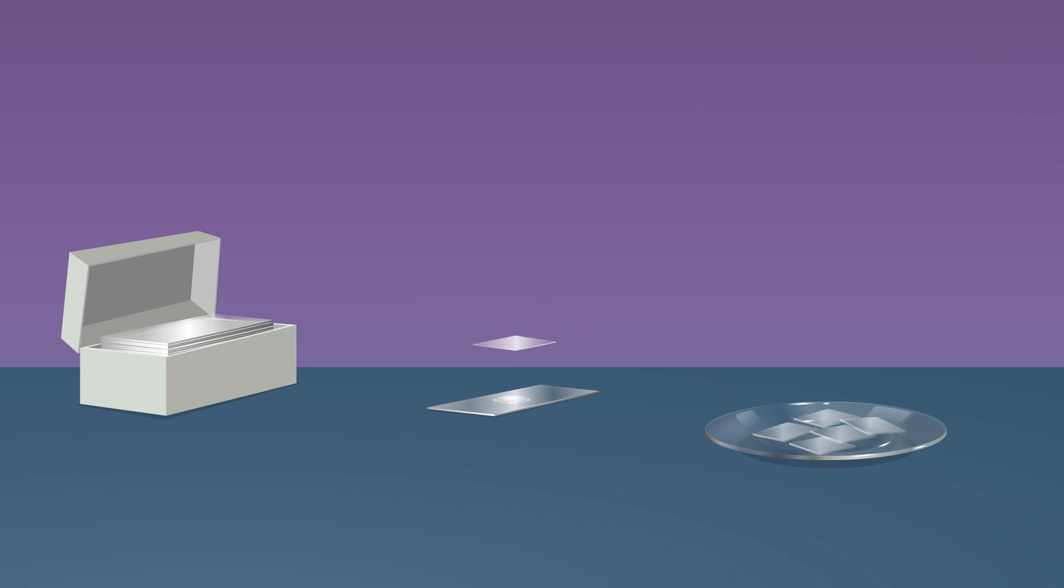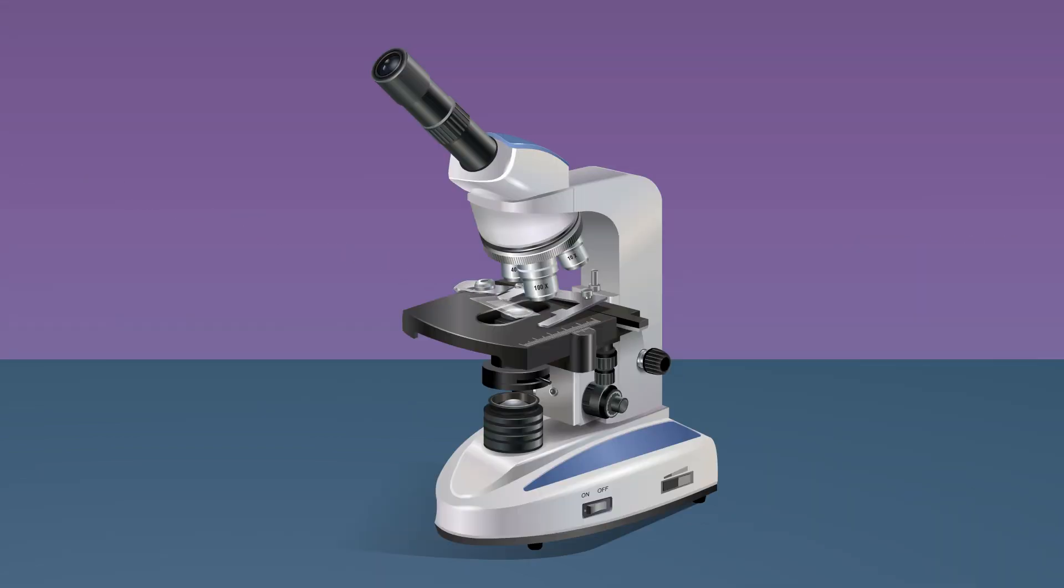Gently place a cover slip over the drop of solution using a needle, ensuring no air bubbles are trapped. Observe the slide under a microscope.